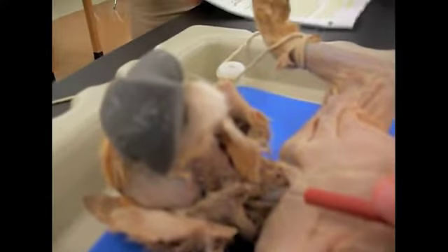The digastric muscle is right here, right under the chin. On the left side, it's the darker of the two muscles you'll see in here, and it originates on the mastoid process and inserts on the mandible, and its function is to depress the mandible. Next to it, you'll see the mylohyoid, which is the muscle directly to the right. It originates on the mastoid process. Correction, it originates on the mandible and inserts on the mid-ventral raphe, and its function is to pull the floor of the mouth up.